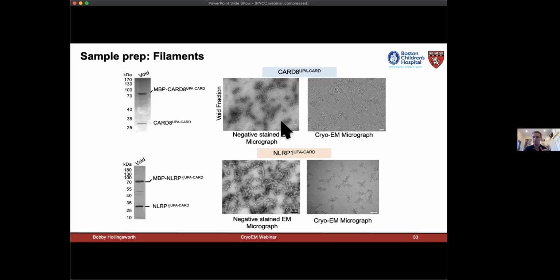And these MBP tags are incorporating into our filaments and probably preventing their elongation. And so we were getting smaller filaments than would have previously been observed for CARD filaments, probably 5 to 10 times shorter. And so they're a little stockier on these cryo-EM grids. And we hoped that the flexible tag would average out during processing. And that was luckily the case. And we could get a reconstruction through segmented particles, even with these small filaments, and luckily we could.